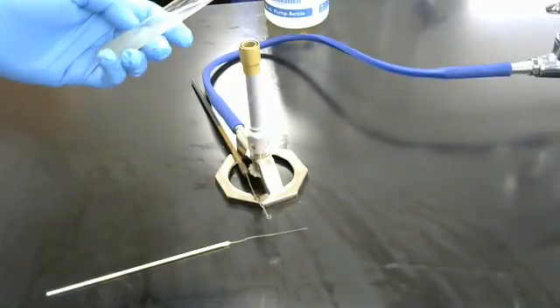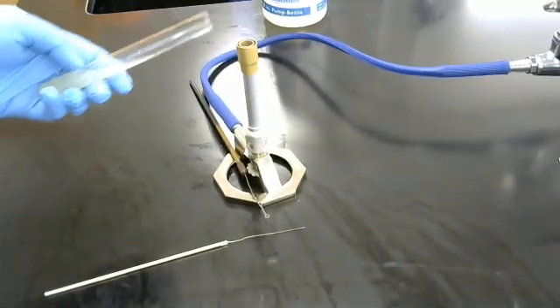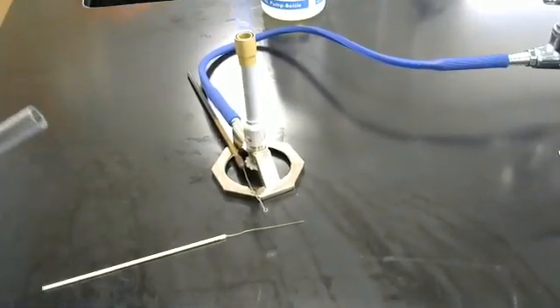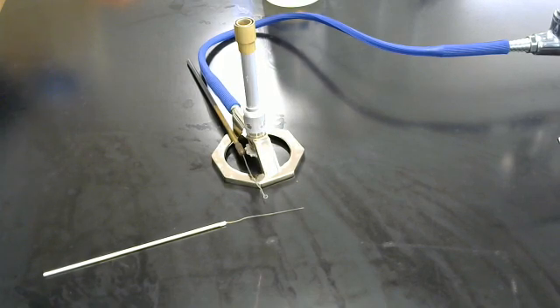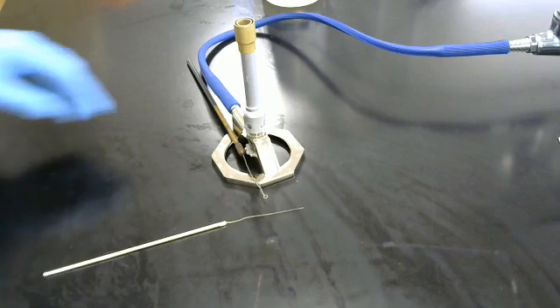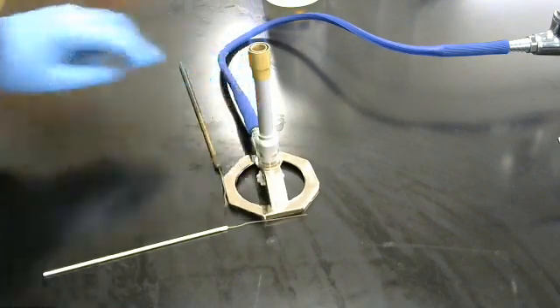Over here. One, two, three. Then, cap. Done. That was easy. This goes right over here. Into our biohazard bin.